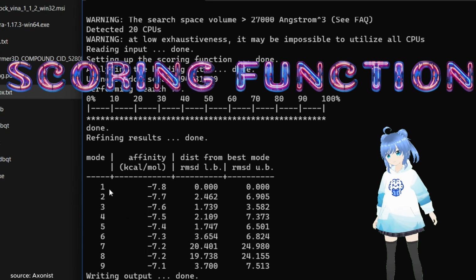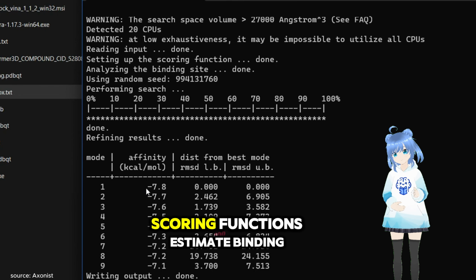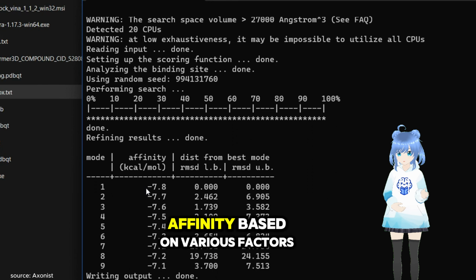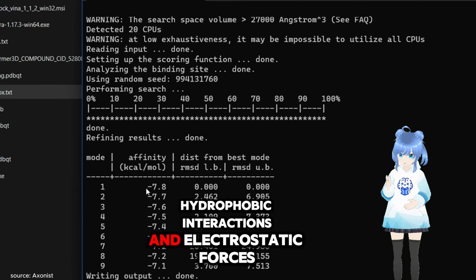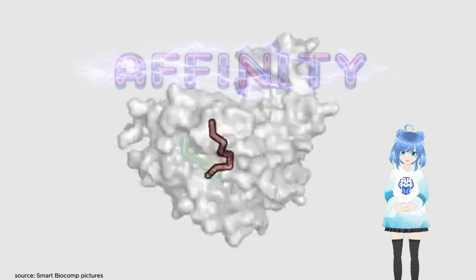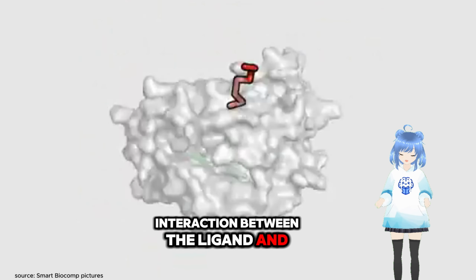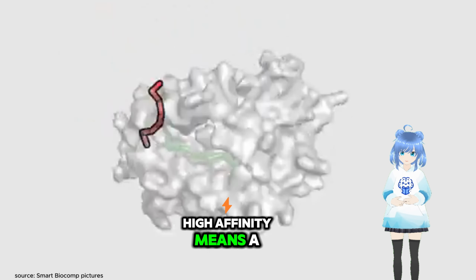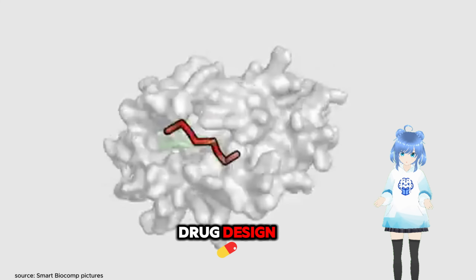Scoring function. This is like a judge in a talent show. It's a calculation used to predict how strongly a ligand will bind to a receptor. Scoring functions estimate binding affinity based on various factors such as hydrogen bonding, hydrophobic interactions, and electrostatic forces. Affinity. This term refers to the strength of the interaction between the ligand and the receptor. High affinity means a stronger and more stable interaction, which is usually desirable in drug design.